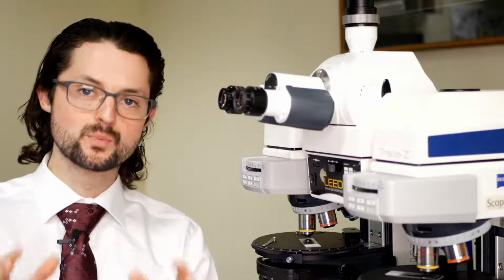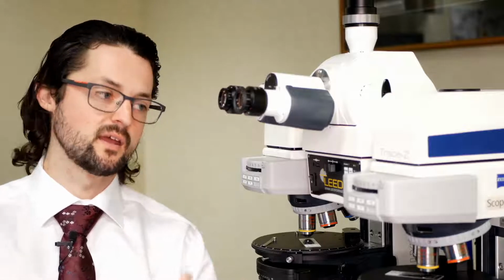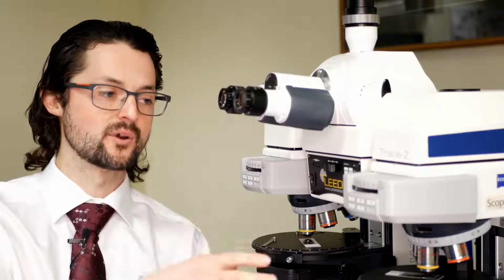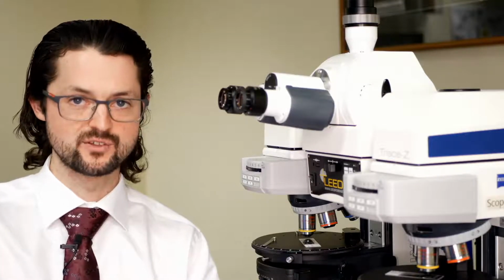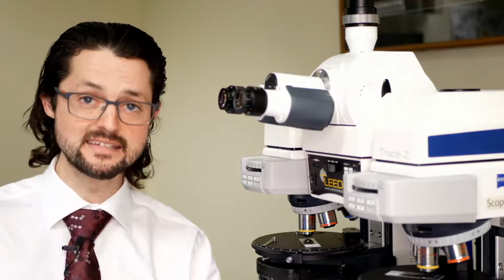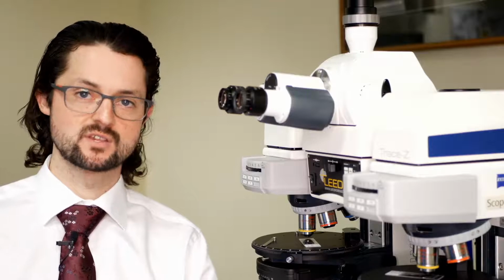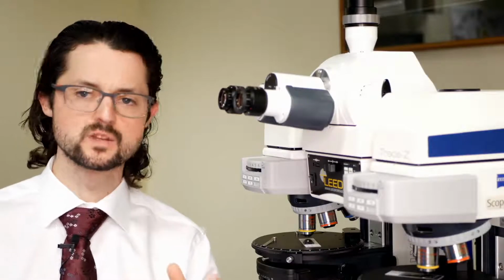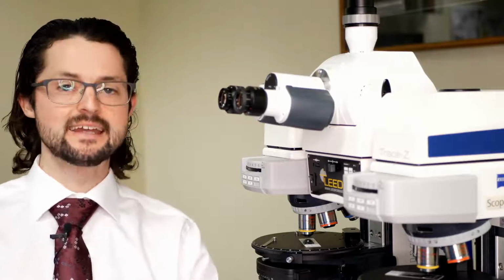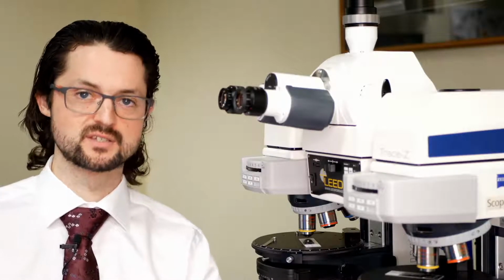But ultimately, why it's important for this video is that instead of having to sell a lab either looking to upgrade a comparison scope of ours that they already have with fluorescence, trying to upgrade it to fluorescence and reflected light Brightfield, two light sources, what we've been able to do is sell a single LED light source. So more and more frequently on our newer comparison scopes, we are selling an Excite 120 LED light source. Essentially, it's LED powered, it's liquid cooled, and it's really, really bright. And it has enough intensity that it works marvelously for fluorescence excitation.